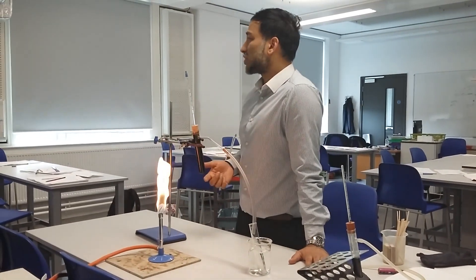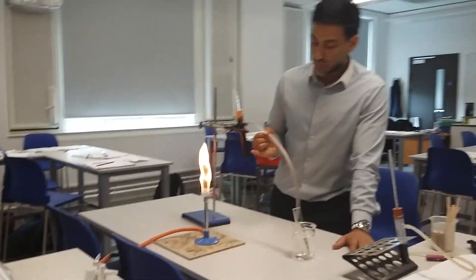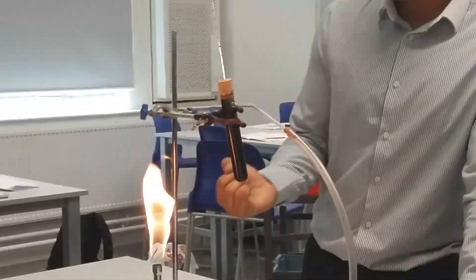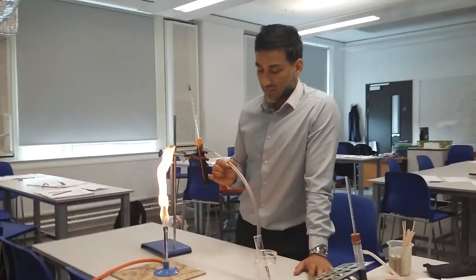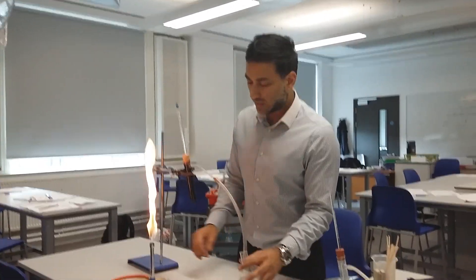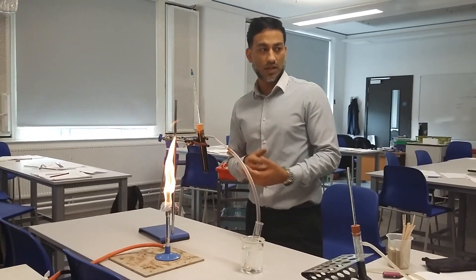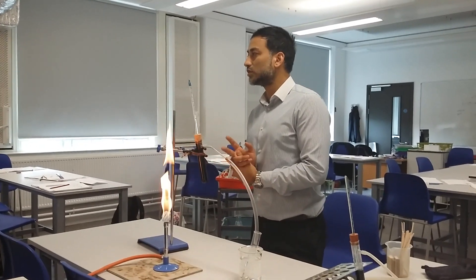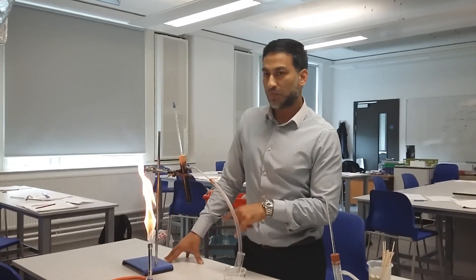So what we're going to do is a fractional distillation of crude oil. This is crude oil in here — this black sticky substance — it's full of hydrocarbons. What we're trying to do is separate those hydrocarbons into fractions. The way we do that is by two main stages. Does anyone remember the two stages? Boiling and condensing.